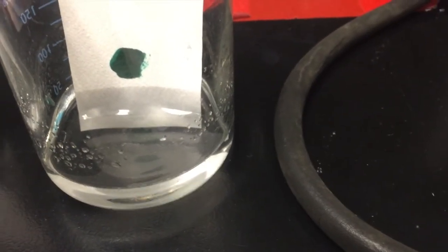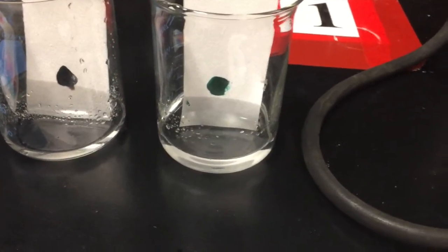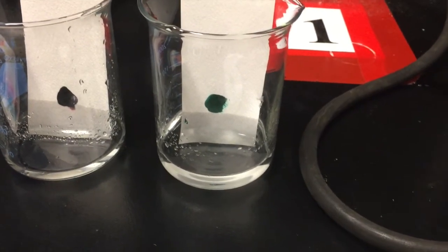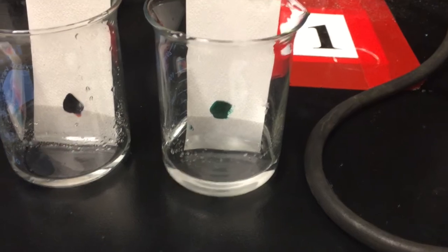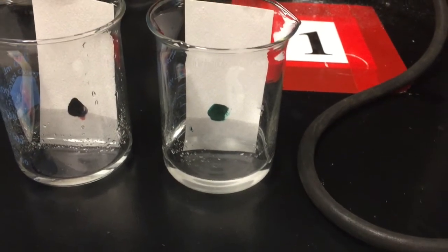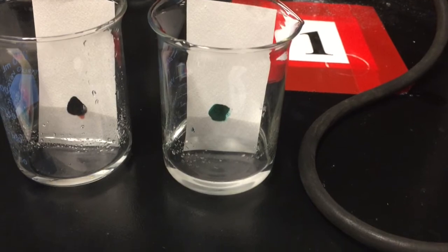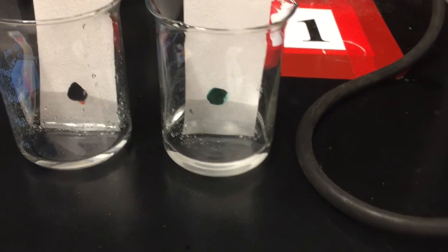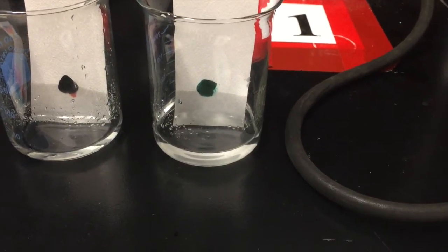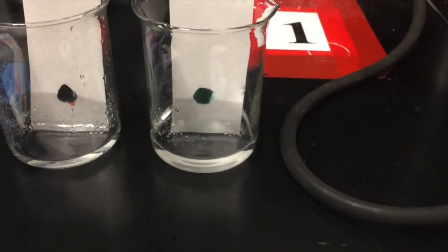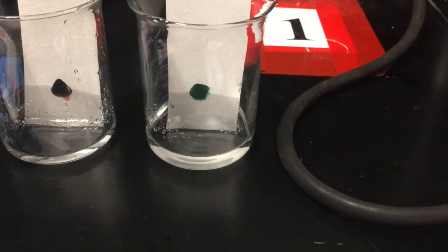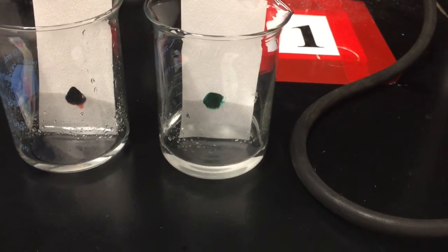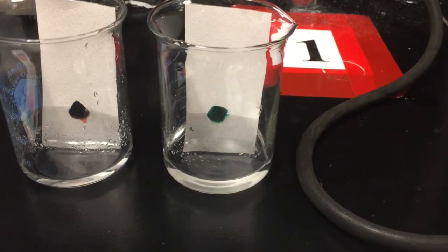Soon, it's going to come in contact with the pigments that make up that black marking pen. And I'm going to do the same with my green dot, my green marking pen. You can see the water slowly wicking up. Of course, when that water comes in contact with those water-soluble pigments, they're going to be wicked up along with the water up the filter paper. And when they do, the different pigments related to their size and how well they're attracted to the filter paper will move at different rates with the solvent. And so we should be able to see a separation of the individual pigments that make up that black and green marking pen. We're going to let that go for a little while. We'll come back to it in just a second while I talk about distillation.